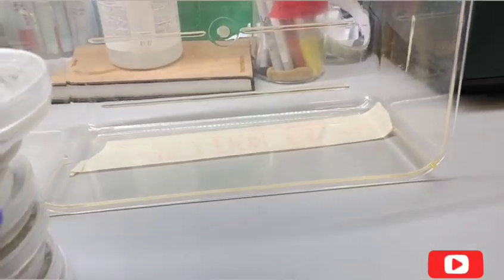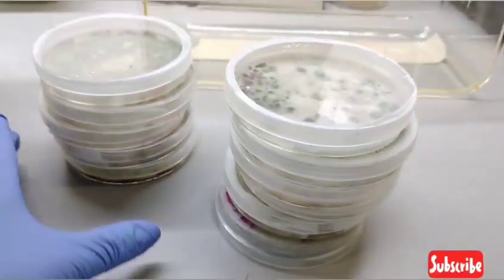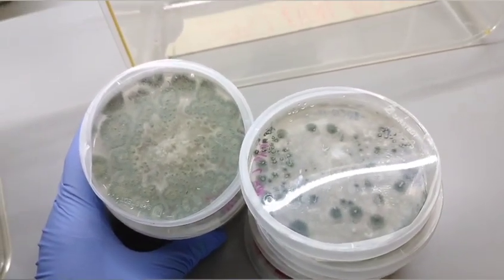Not it, not it, not it. I'm just going to toss these into the garbage. Well, what I'll do is I'll make up media so that I can try and subculture the new set of pathogens. So I'll do that part first and then tackle trying to isolate it again, maybe today or another day. My day just started and I'm already over it. Oh my god.